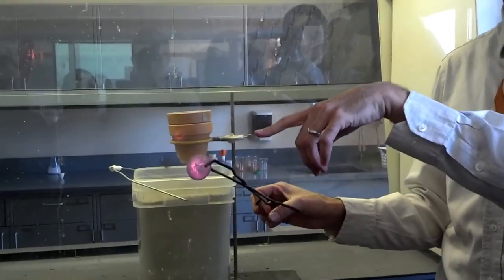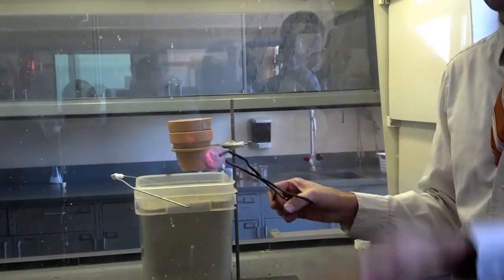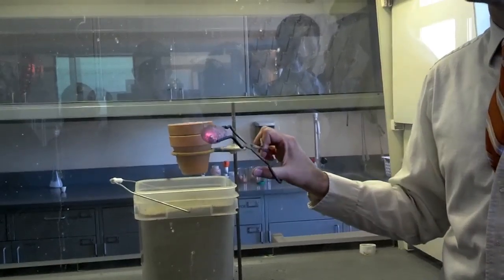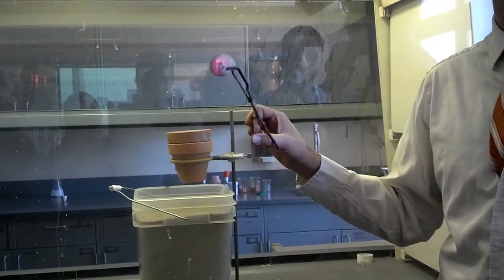You saw how white hot it was before? And you saw we got that little bubble. But even that bubble didn't drip, right? It wasn't that hot that it could flow very well. Yeah. It's kind of like magma though. Except not molten rock, molten iron.